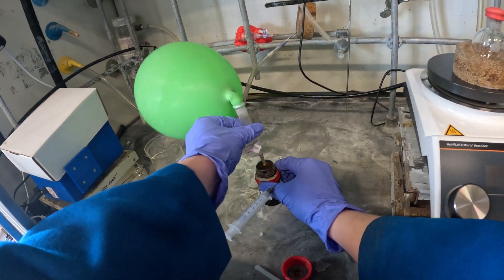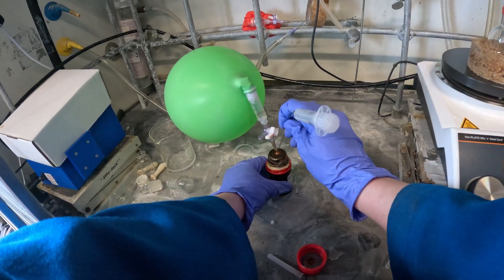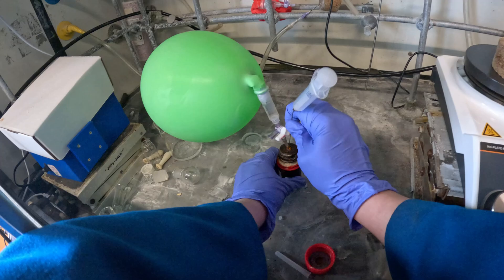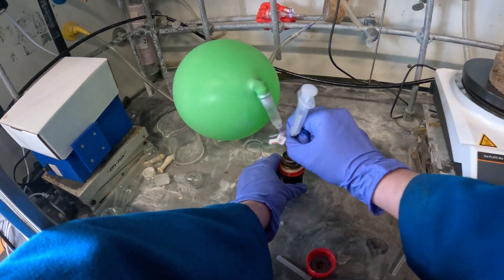I'm going to put in my purged needle and syringe into the sure seal. Get in, argh! Okay.